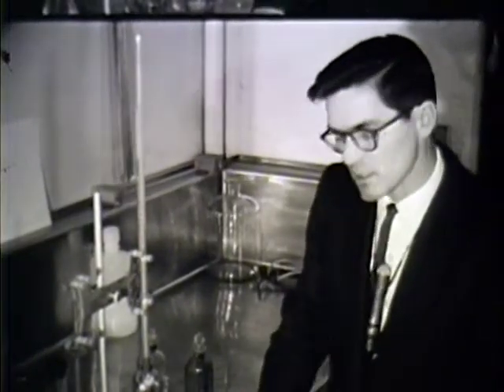Now, the determination of the amount of oxygen present in a given body of water is probably one of the best indications of the condition of that body of water. A low concentration of oxygen is usually indicative of a high concentration of partially decomposed organic material or the superabundance of animals or fish, or any organism present which may deplete the oxygen.